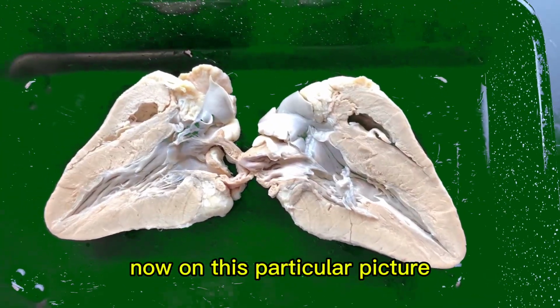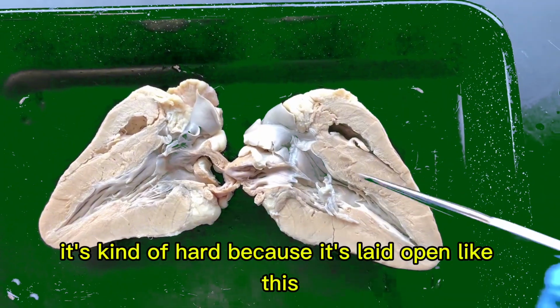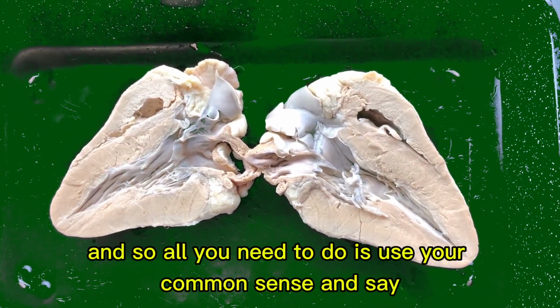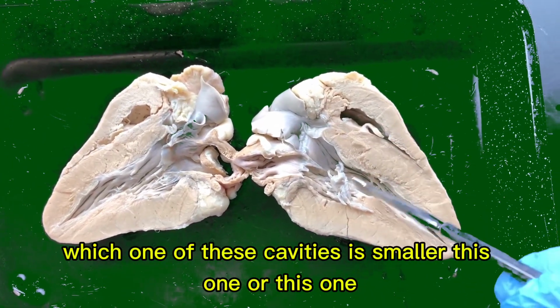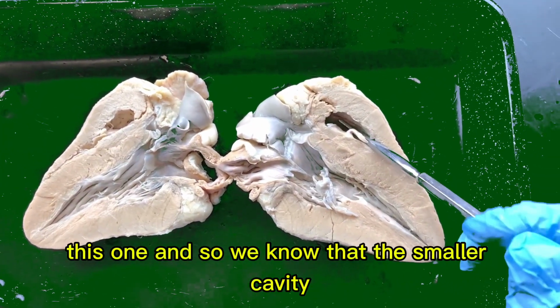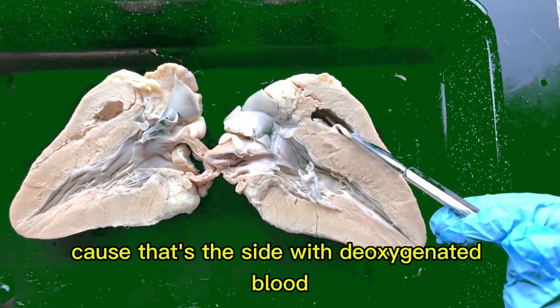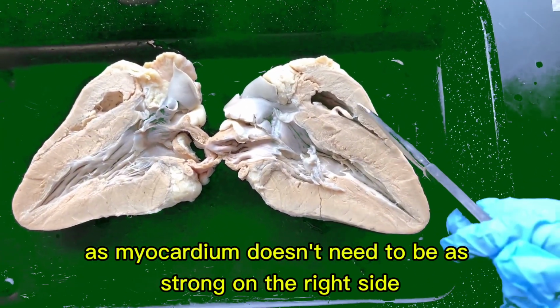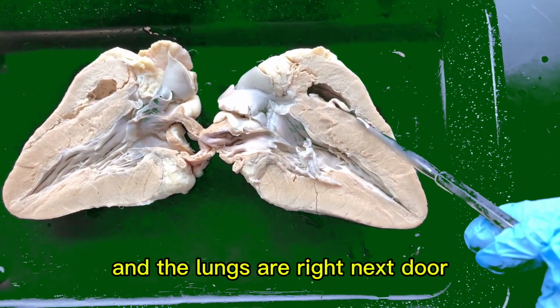Now on this particular picture, it's easy to see on the heart model, but on this it's kind of hard because it's laid open like this. And so all you need to do is use your common sense and say, which one of these cavities is smaller? This one or this one? This one. And so we know that the smaller cavity or the smaller room on a heart is going to be on the right side, because that's the side with deoxygenated blood. Doesn't need to be as strong. This muscle, this myocardium, doesn't need to be as strong on the right side because this side only pumps to the lungs, and the lungs are right next door.